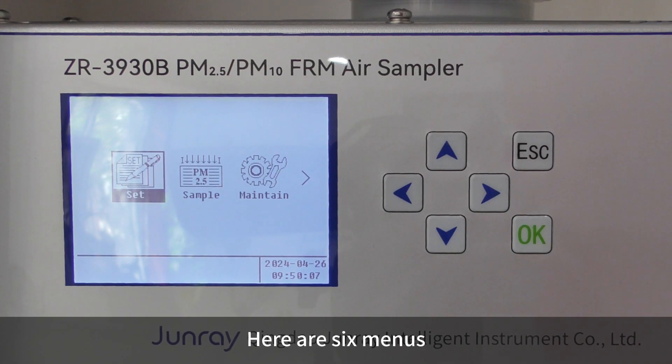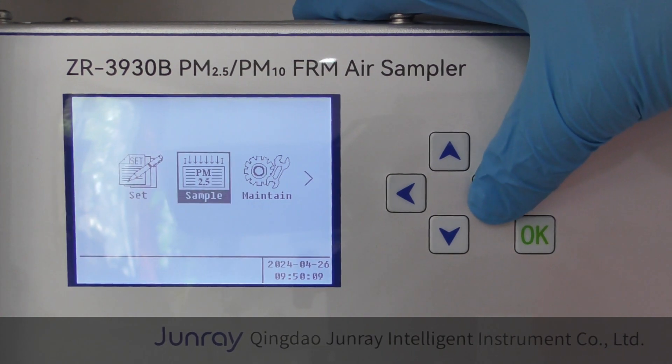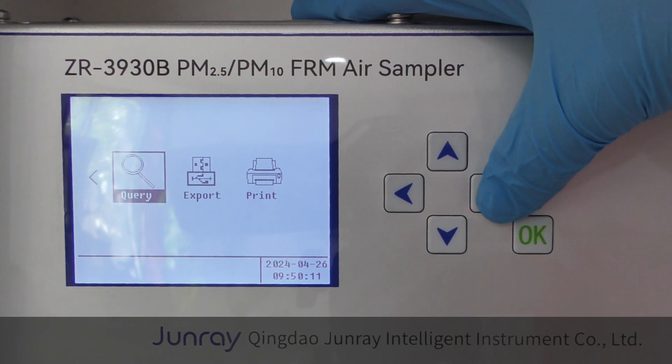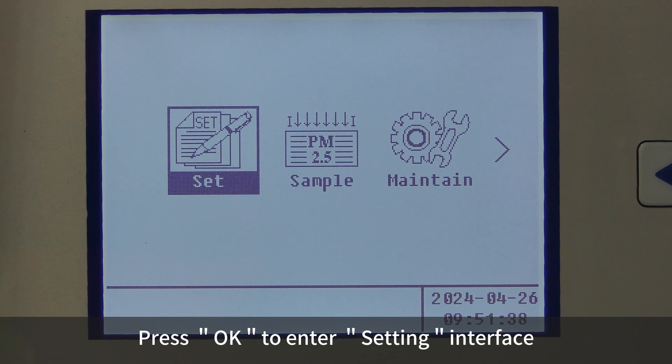Here are six menus: Set, Sample, Maintain, Query, Export, and Print. Press OK to enter the setting interface.